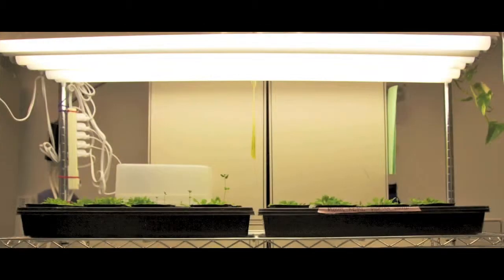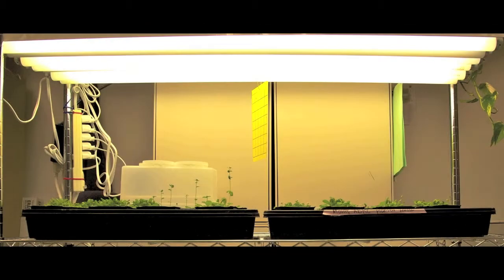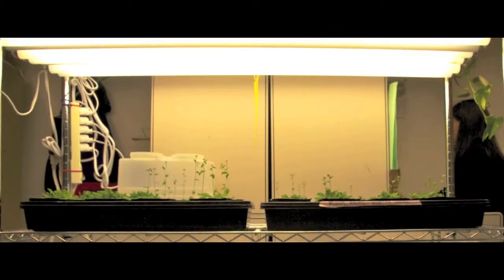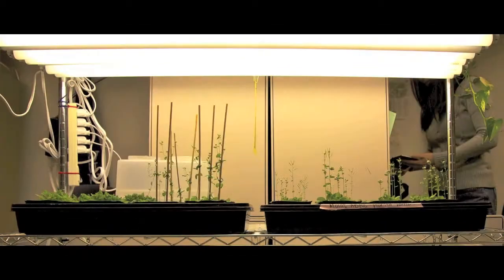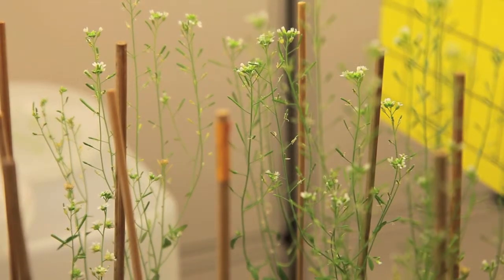For the next few weeks, allow the plants to grow largely undisturbed. Notice how after four weeks, the plants will begin to bolt and flowers will start forming. You may choose to tie down some of these flowers to sticks, though this is entirely optional.